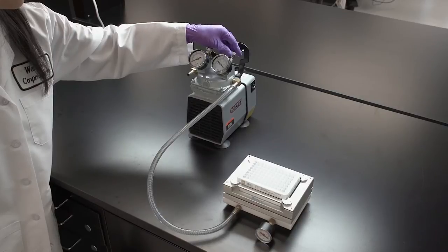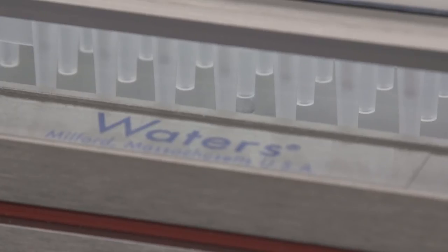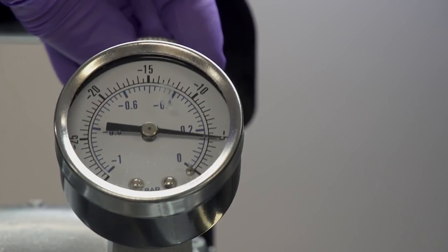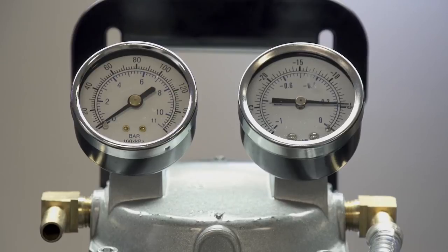Turn on the vacuum gradually to increase vacuum until you see approximately one droplet per second coming through the plate. Adjust the vacuum to maintain the appropriate flow rate. We suggest you start with a slow flow rate to avoid analyte breakthrough.